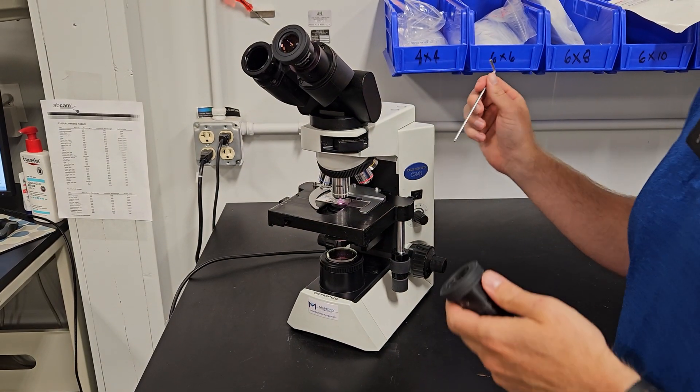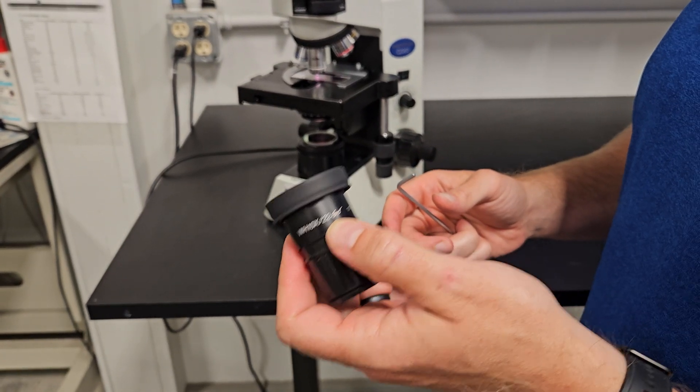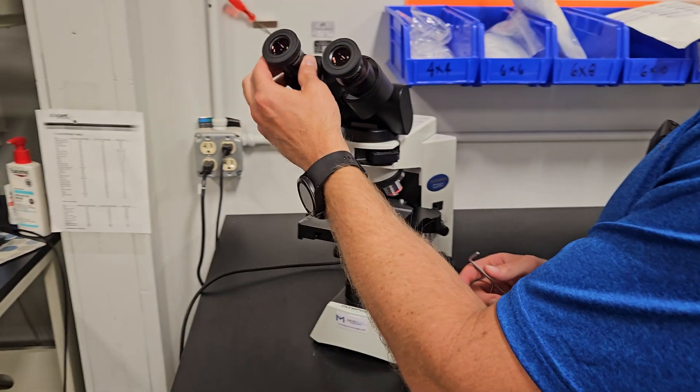Usually a CX will come with a 10x by 20 millimeter field of view, but you can put the 10x by 22 millimeter field of view eyepieces on there. So we did that.